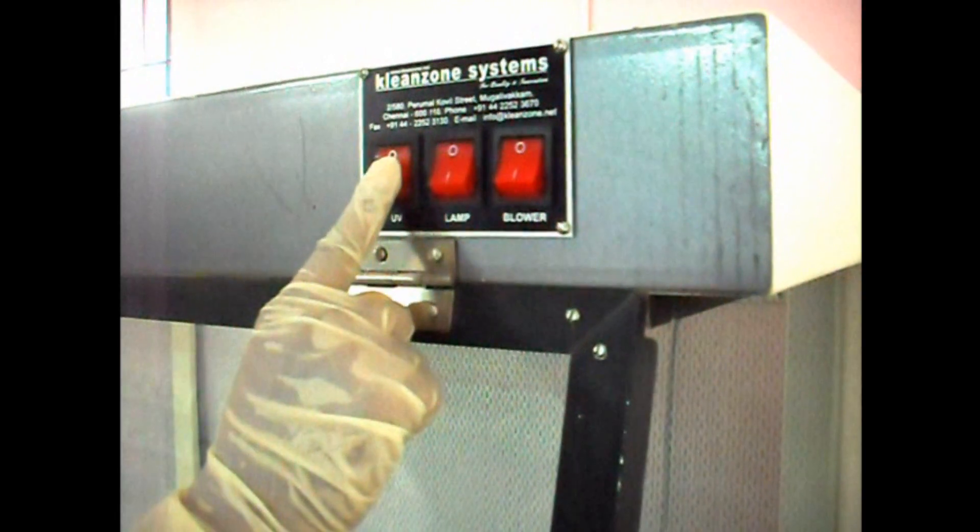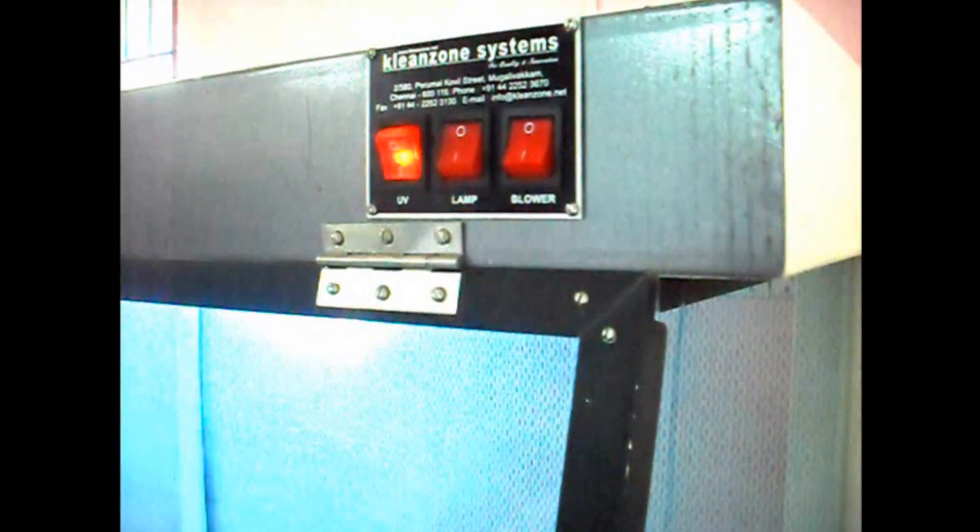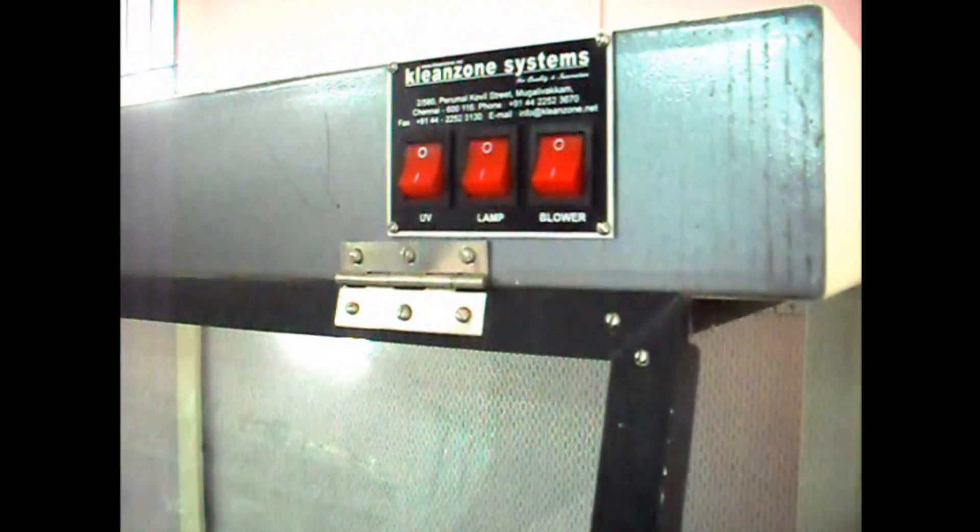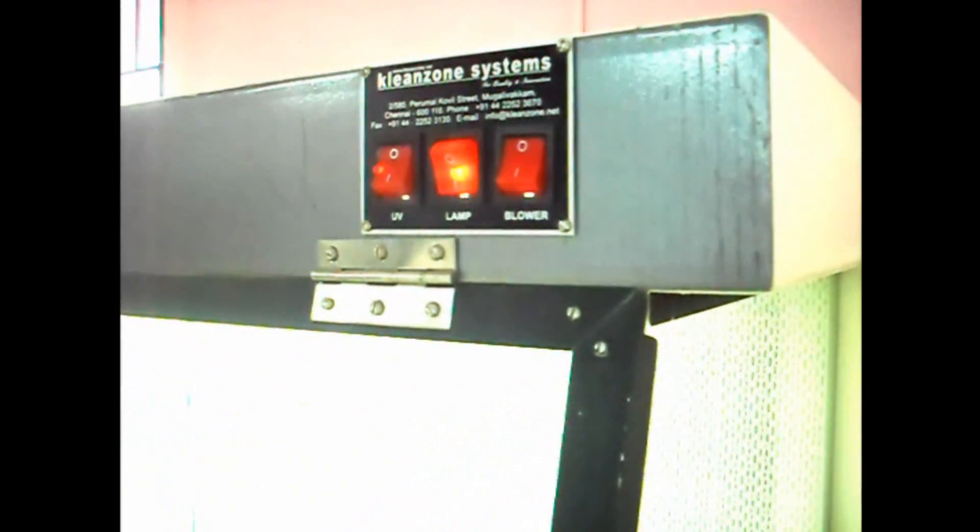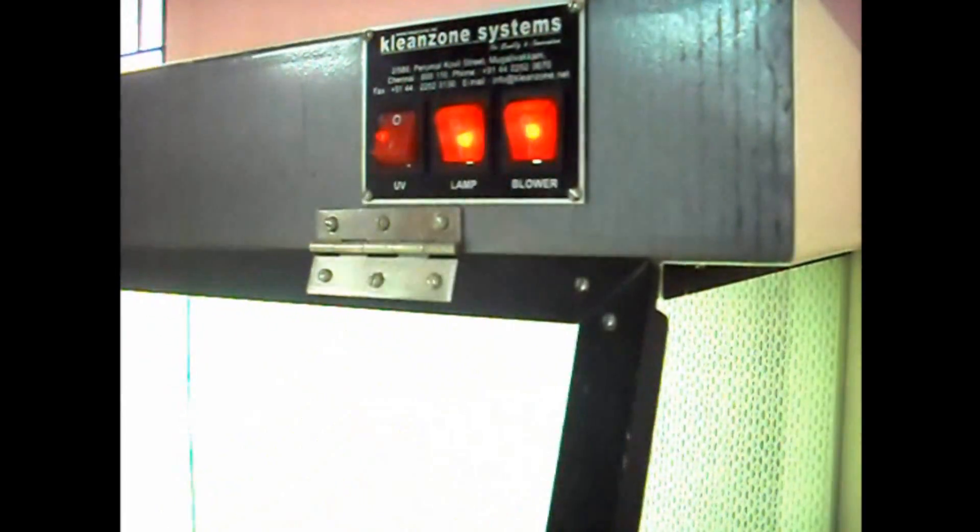First switch on the UV light. Switch it off after 20 minutes and switch on the lamp and blower. Open the laminar airflow chamber.